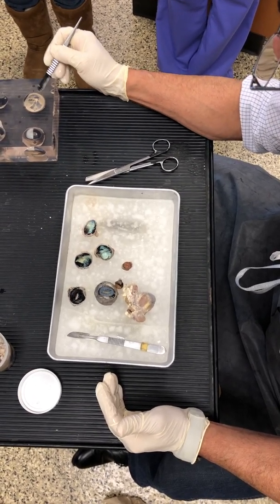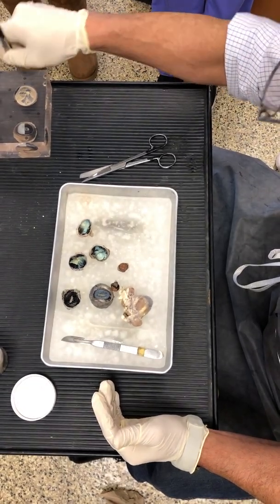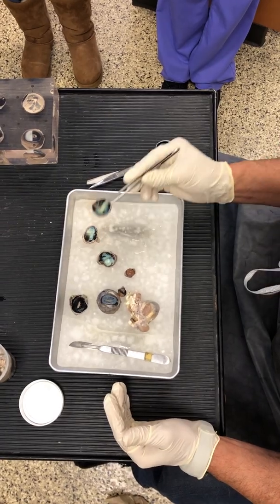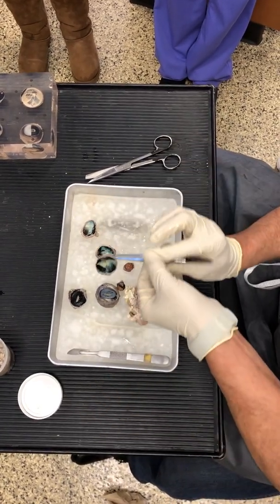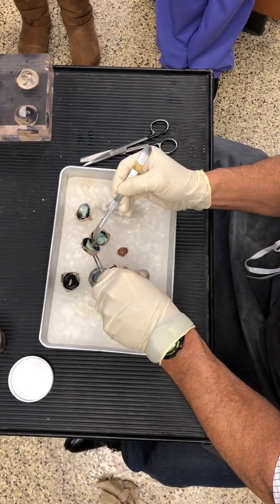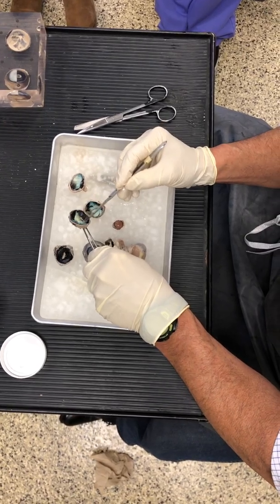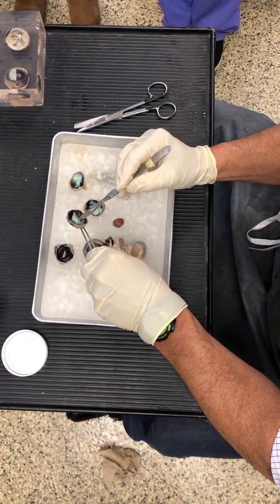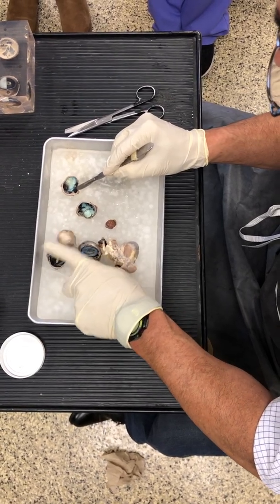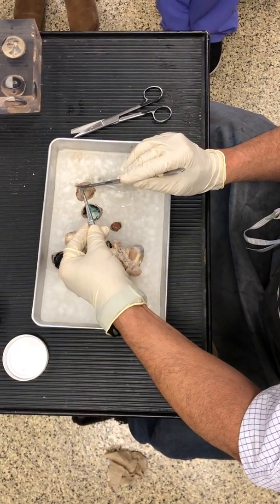And it all runs out at that dot. What is that dot called that runs out? The optic disc. So there is the retina, the creamish thread, and it attaches right there. That is where the optic disc is located. So the optic disc is inside the eye, and what is outside the eye is the optic nerve.